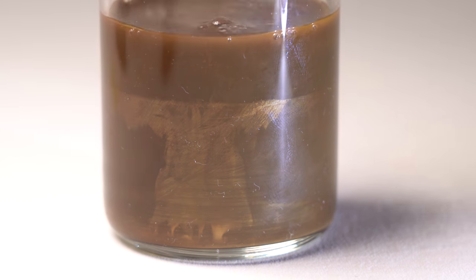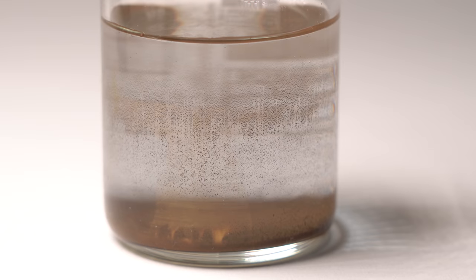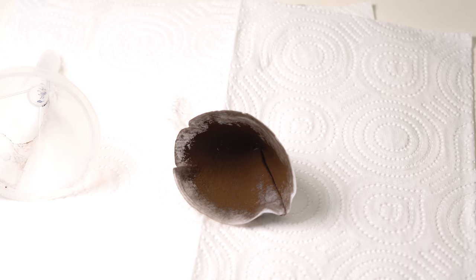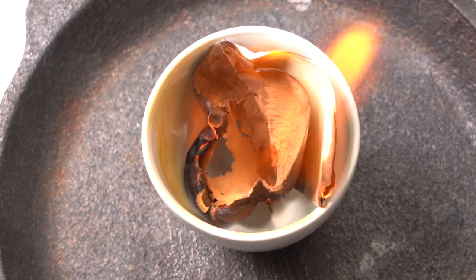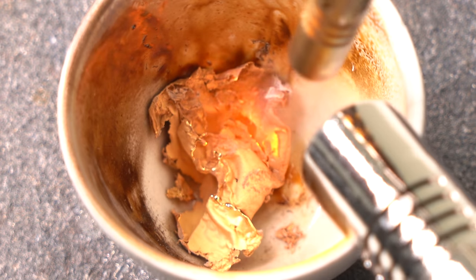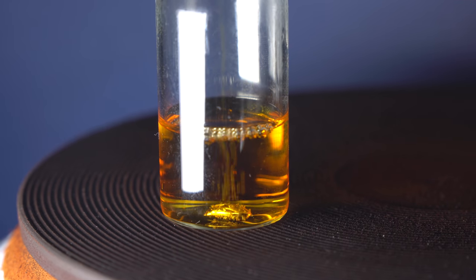The deposited gold doesn't actually look like gold — the particles are too small and cannot reflect light like a whole nugget. After depositing, I am filtering the gold particles with a regular filter. In order not to lose any of the precious gold, I am not separating gold from the filter; rather I am drying the whole filter and then burning it in a small crucible. When being melted, the majority of gold remains in the flux while the paper filter just burns down. With the help of a gas burner I managed to turn that weird powder back into a gold droplet. For my next experiments I needed soluble compounds, so I dissolved my gold once again.